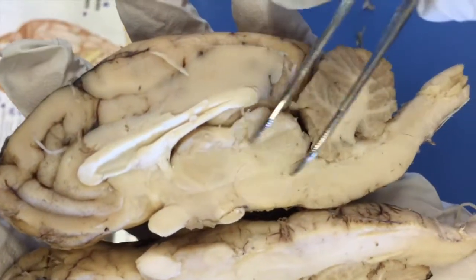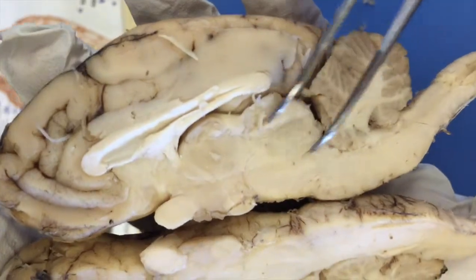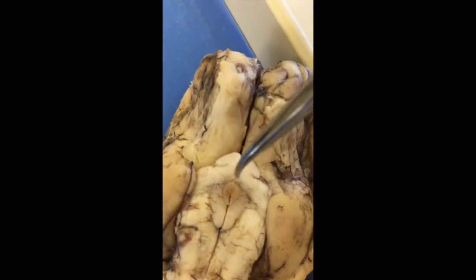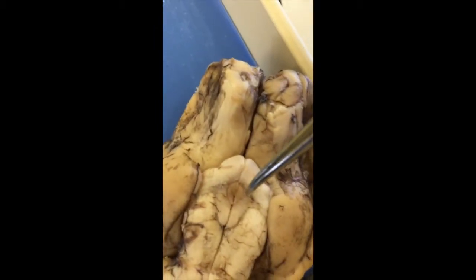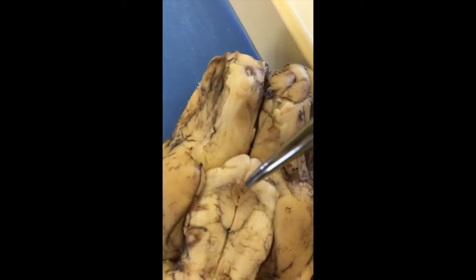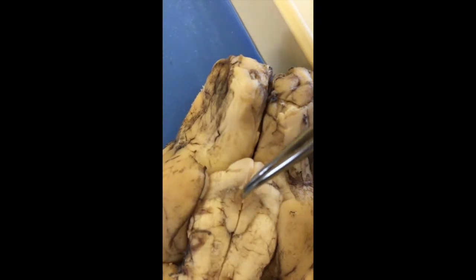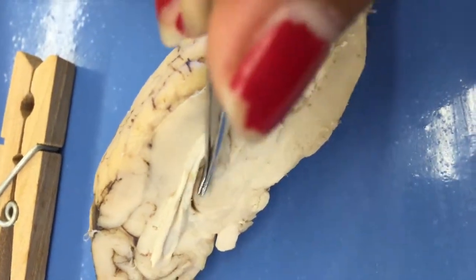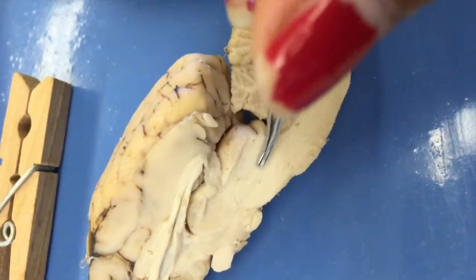And then the diencephalon is that whole region, which includes the thalamus and the hypothalamus. So right here is where the optic chiasma is, where this crosses. This is the infundibulum, this area right here. And then these two little pieces of gray matter is where the pituitary gland is. These are the mammillary bodies right here. This is the thalamus right here, and then this is where the hypothalamus is.